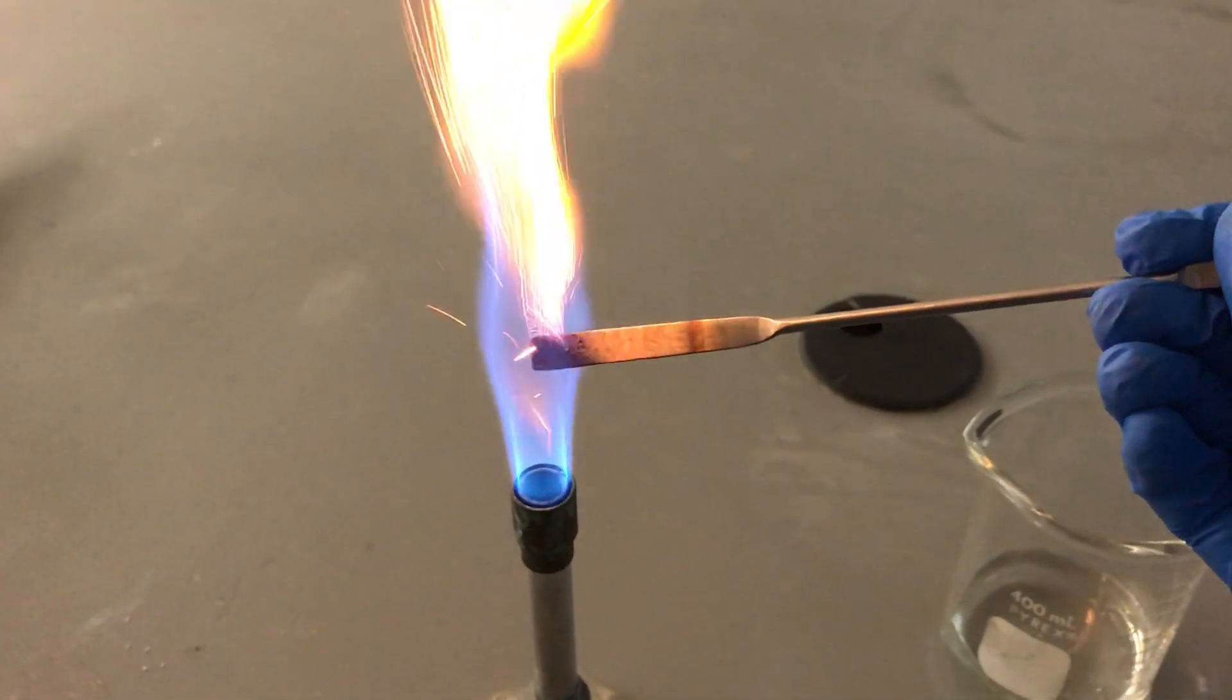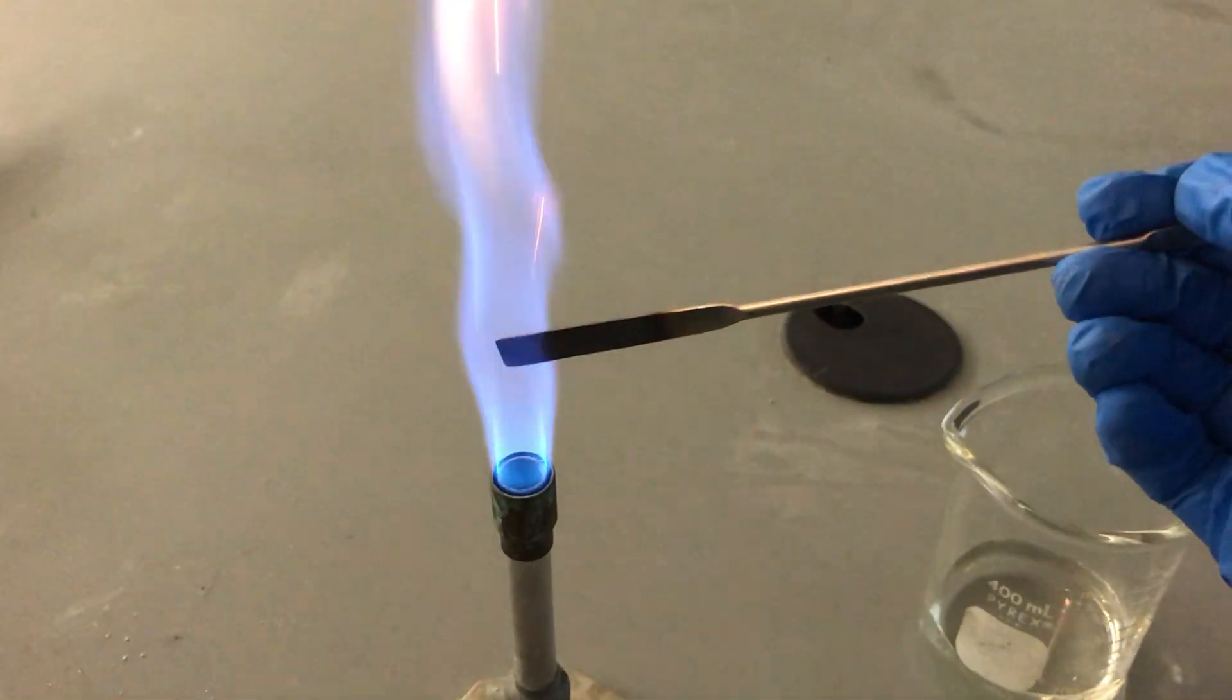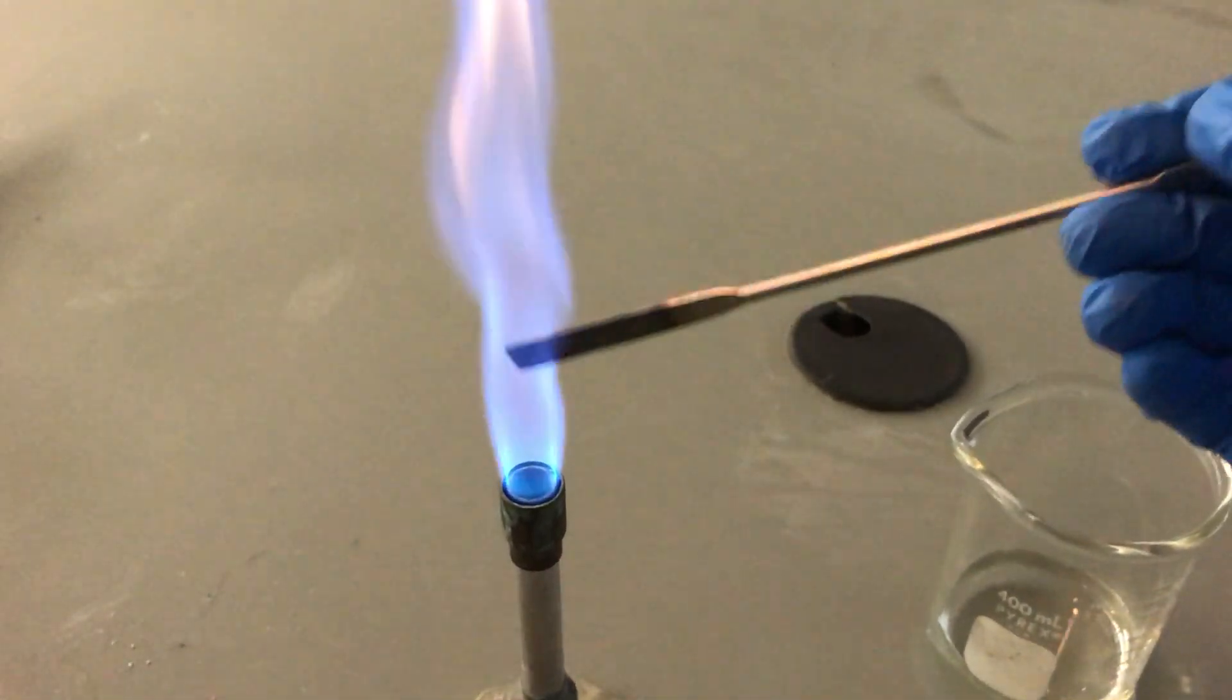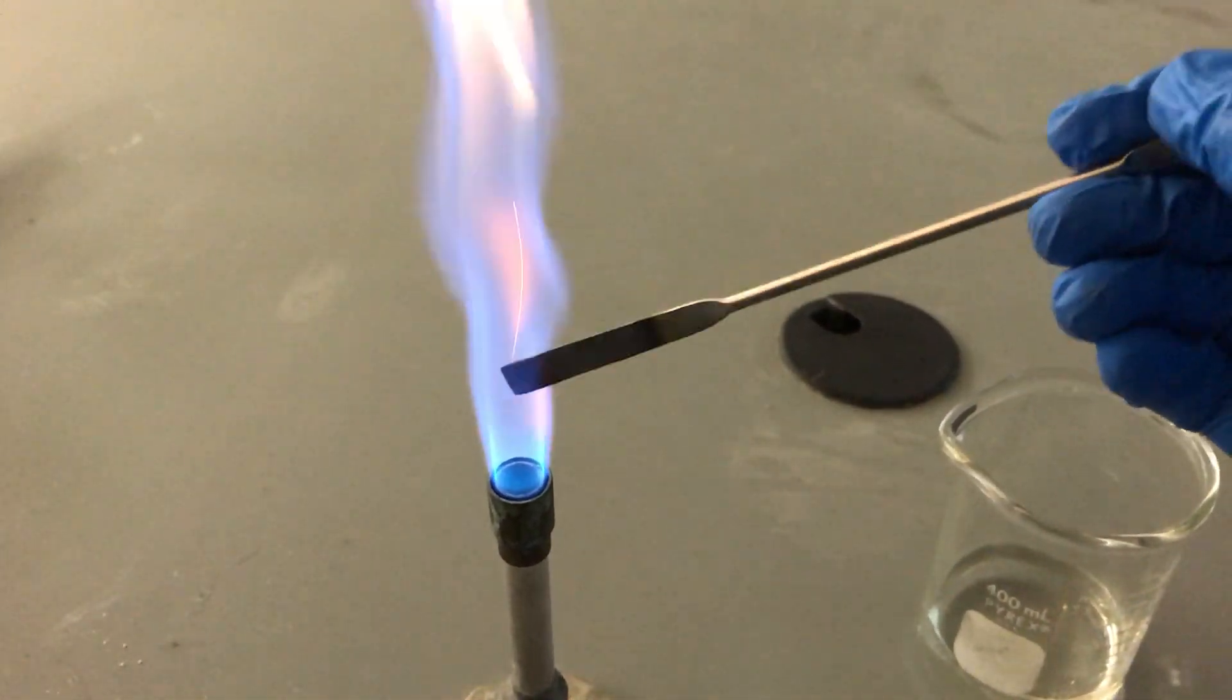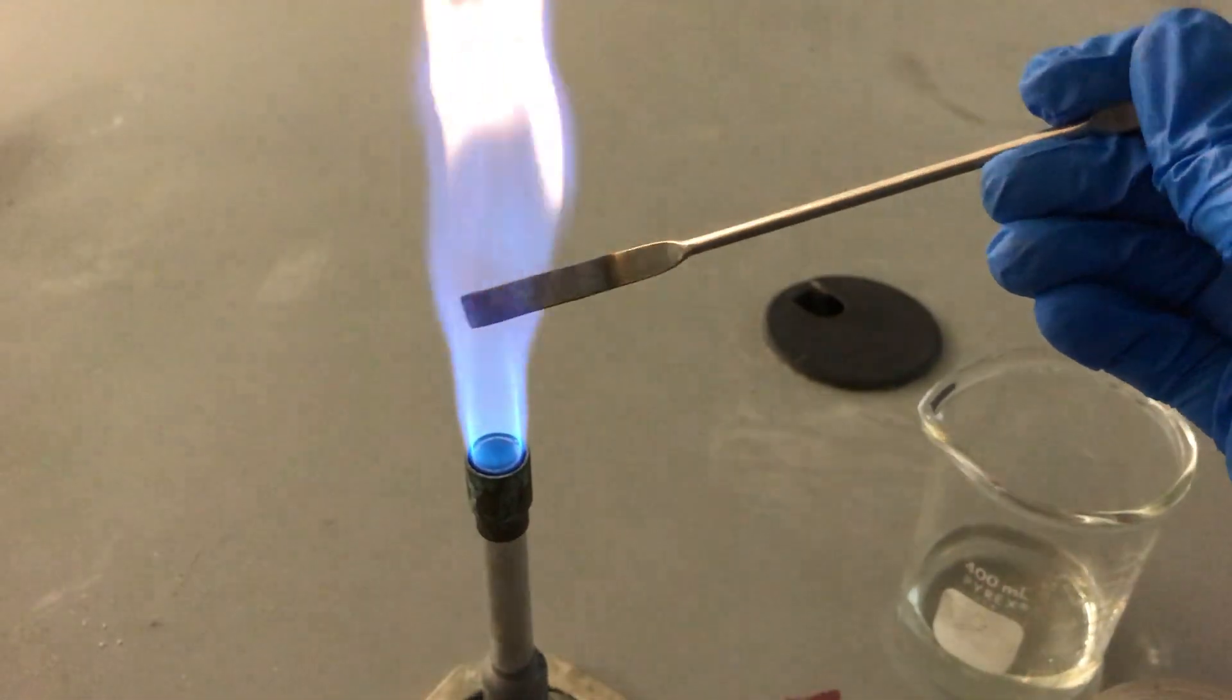And if we look at it closely, once again orange and sparkles, very similar to our crime scene sample. Our suspect sample also had orange and sparkles.